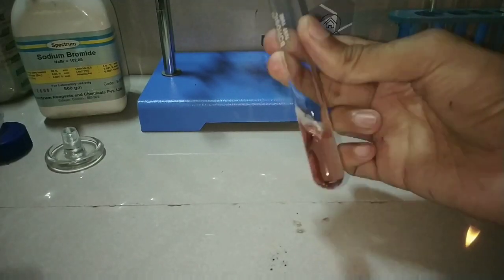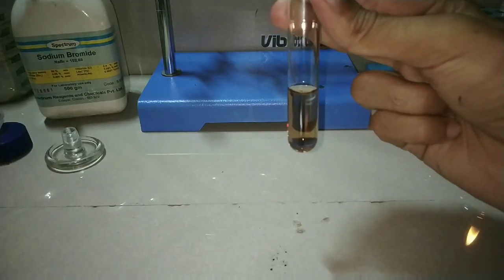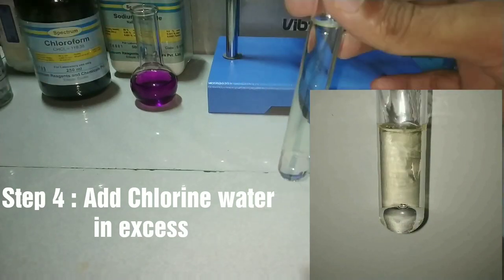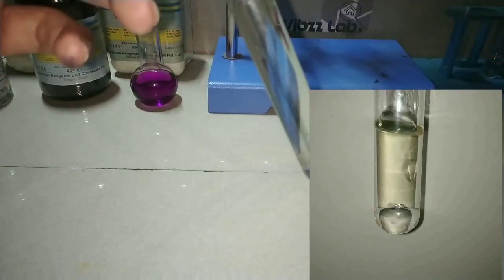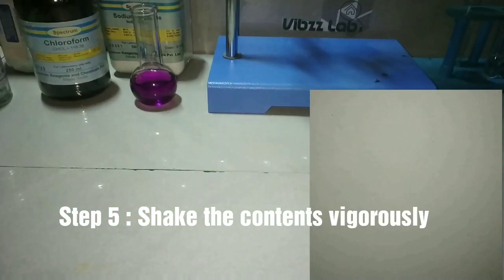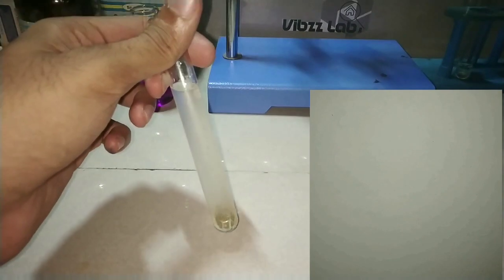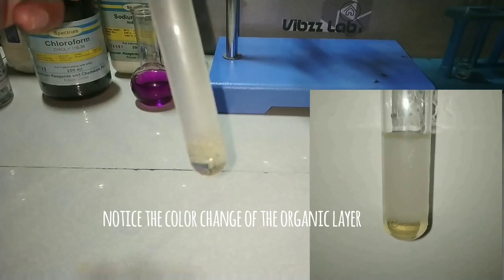Finally we have the color change — it has turned to a pale brown color. Now we will be adding this freshly prepared chlorine water into the mixture of water and chloroform. There is not much appreciable color change when I added the chlorine water initially. Now we will shake the mixture very well. Observe the color change in the bottom chloroform layer — you can see a yellow to orange color.